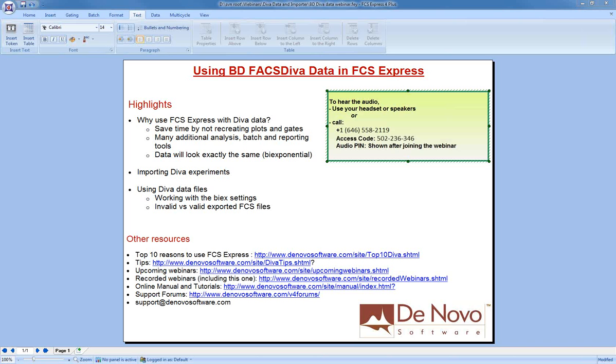The other advantage of FCS Express, once you've chosen to use a third-party tool, is that the data will be exactly the same. FCS Express uses the exact same biexponential settings and offers even more flexibility than Diva does in that regard. So again, we've created the import tool in order to help you save time and get your analysis going quickly. So the first thing I'm going to do is show you an analysis inside Diva and then bring it into FCS Express, and I'll go through the steps that are involved to make that happen.